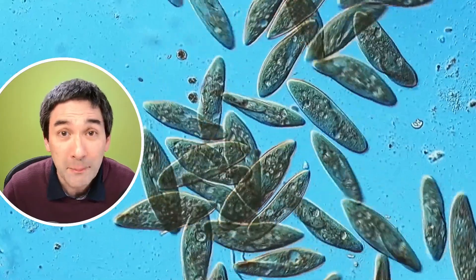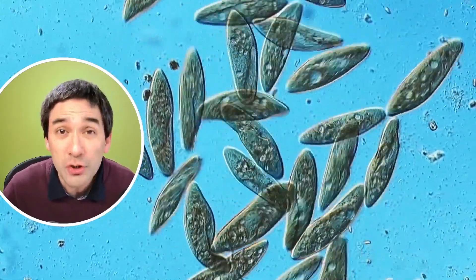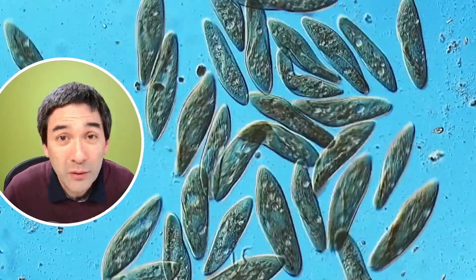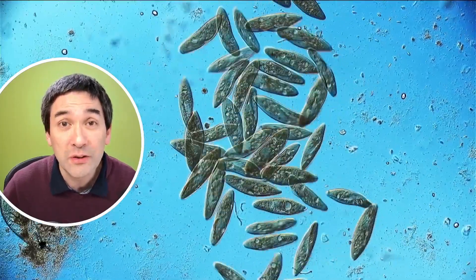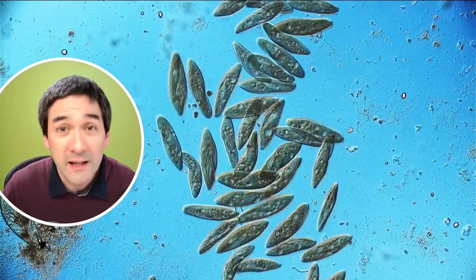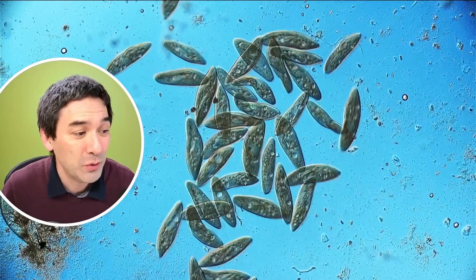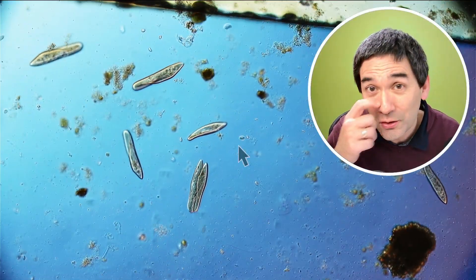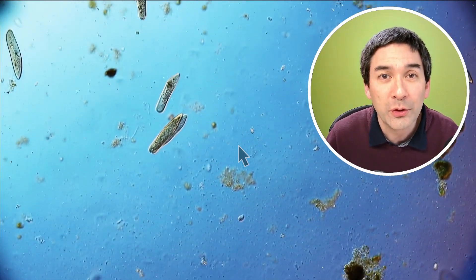These microorganisms have a mechanism of ensuring that their DNA is always changed, exchanged, refreshed, and modified. I would like to show you how they do that. I've added a substance called methylcellulose to slow down their movement a little bit. But there are some individuals over here that are a little bit interesting.